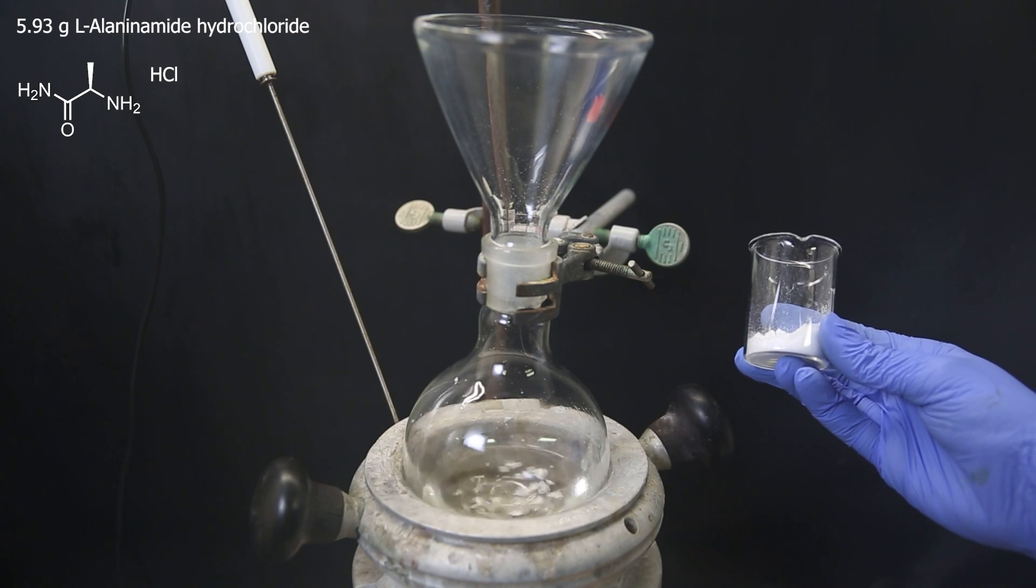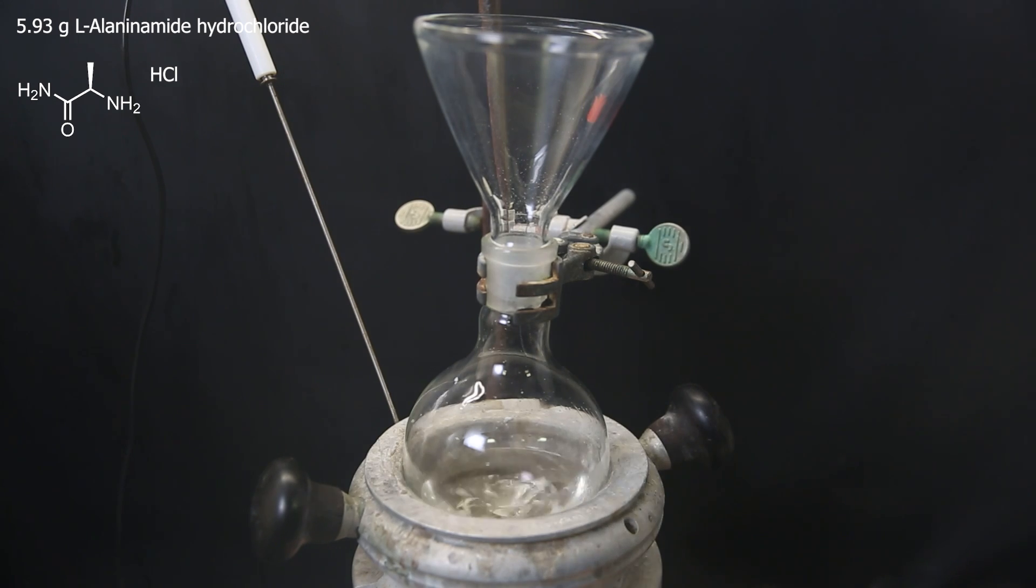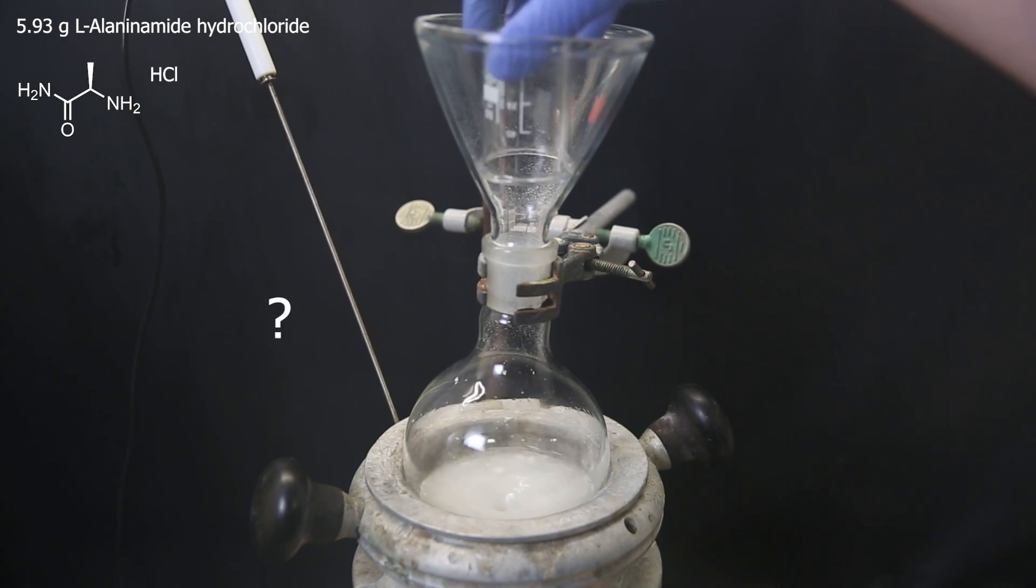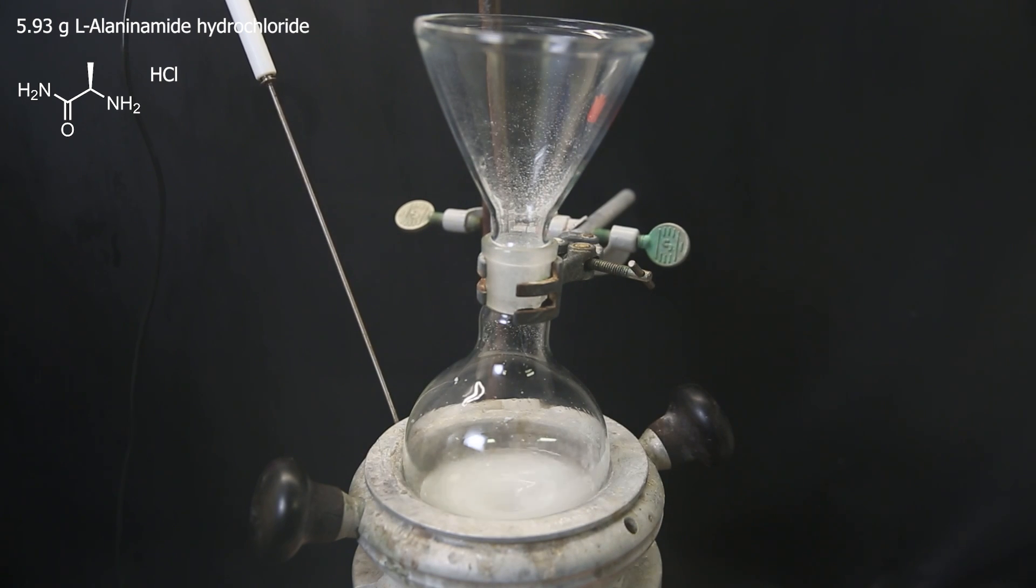And then 5.93 grams of L-alaninamide hydrochloride as the second reactant.